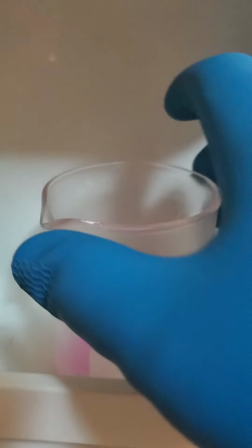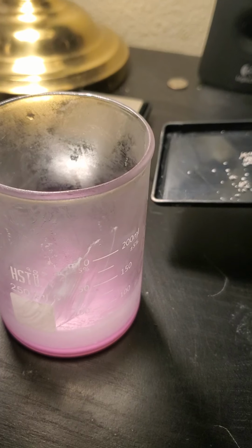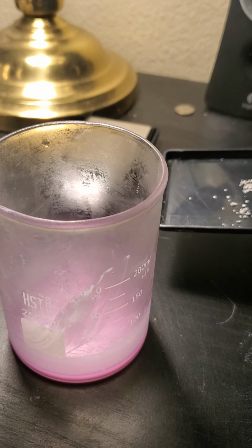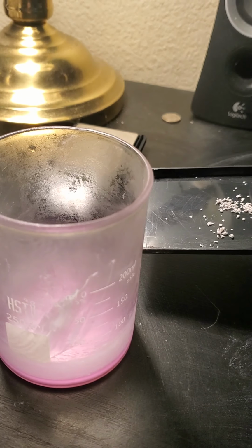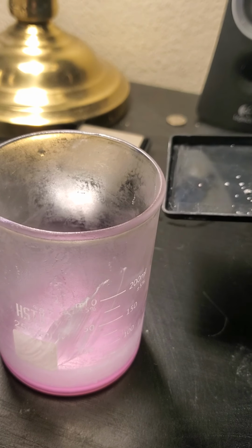Okay, from the second activity, I have cooled the calcium hydroxide solution from the first experiment. Next, I'm going to add exactly 0.18 grams of the eggshell, which is the calcium carbonate.